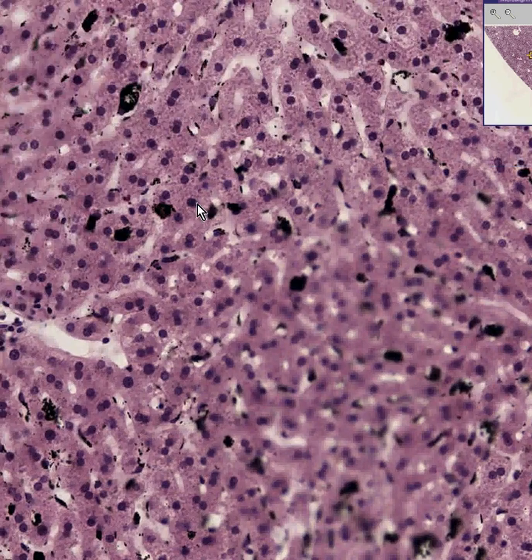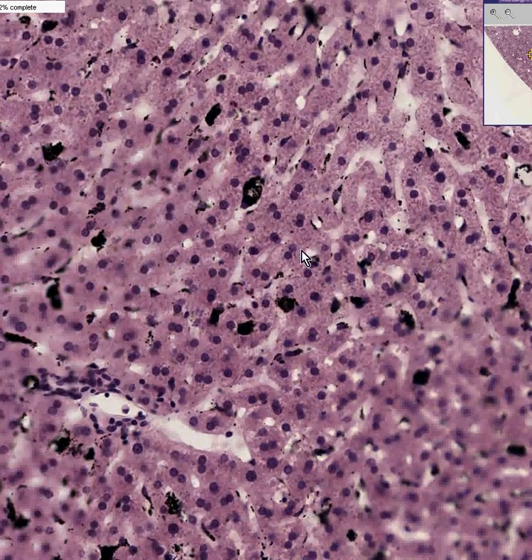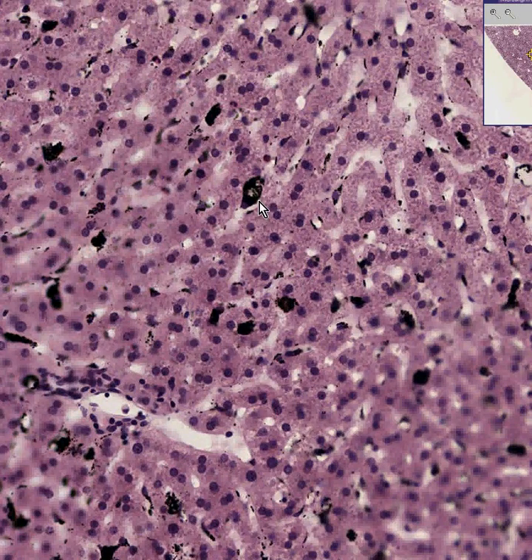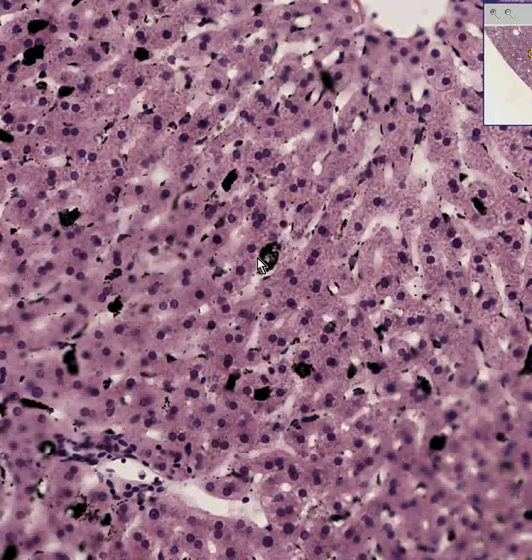This slide even helps you, because in this slide, this patient, or perhaps animal, was injected with carbon particles.